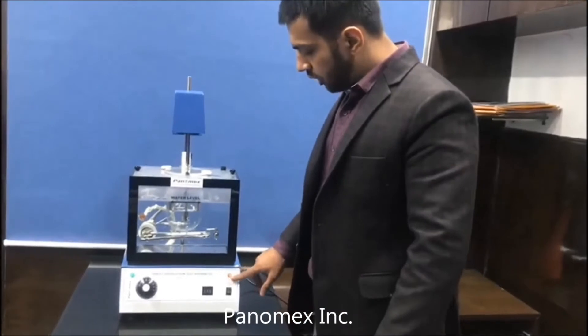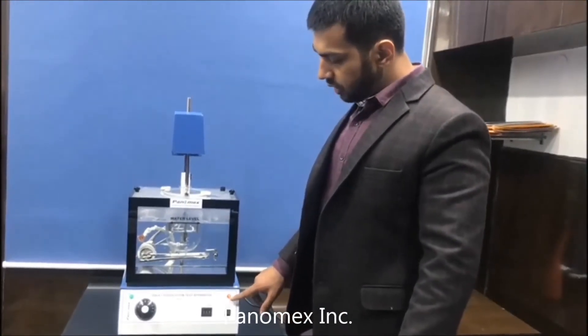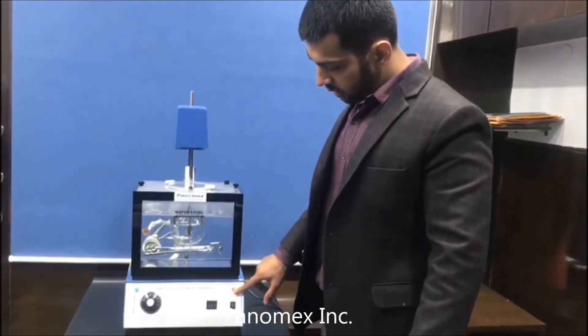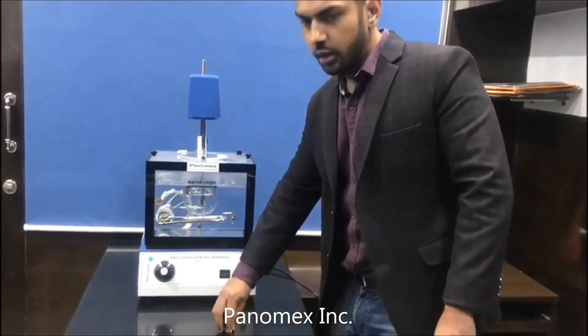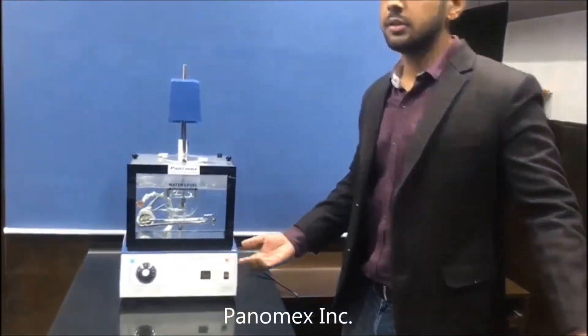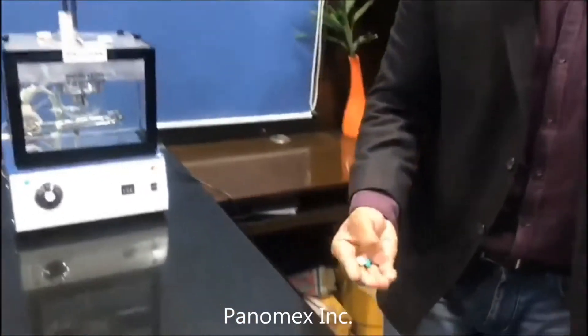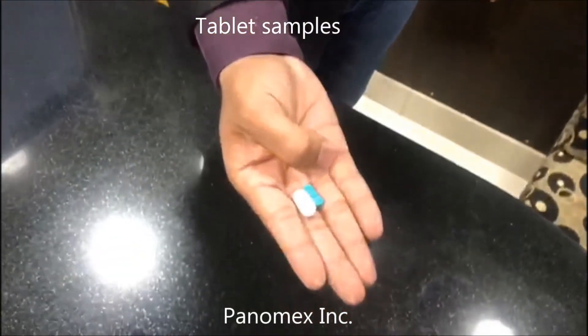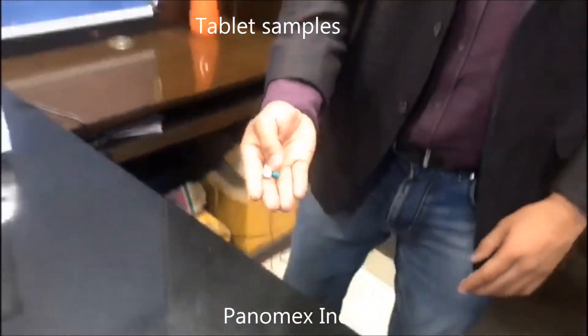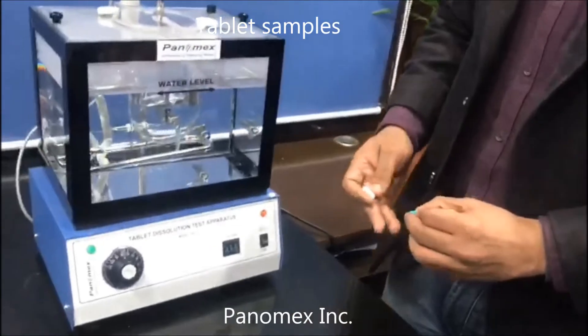This machine is on now. As you can see, the light is showing over here. I'm here with these samples. Now I'll place them in this.